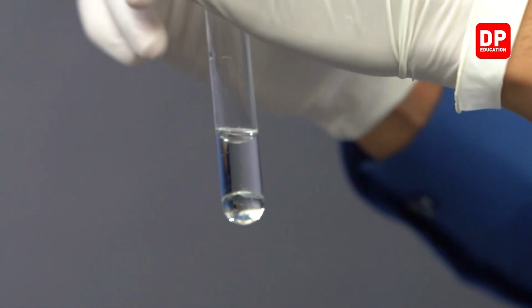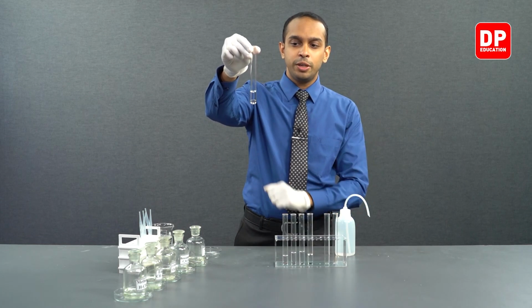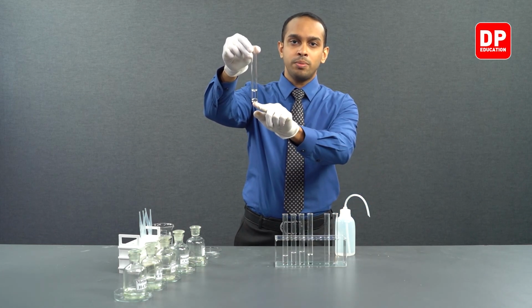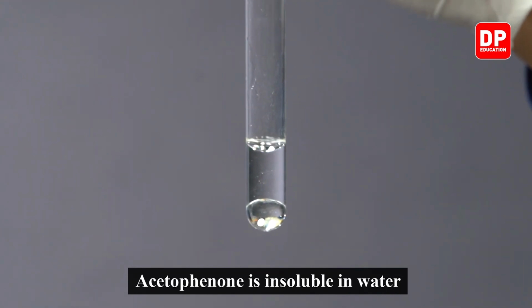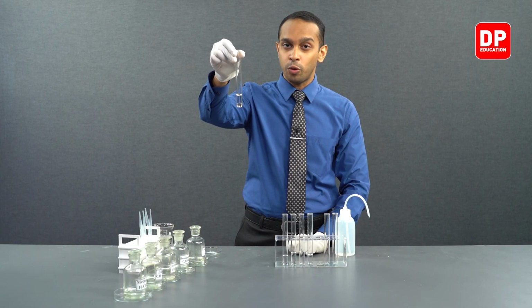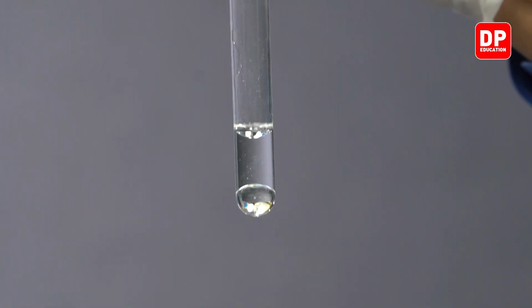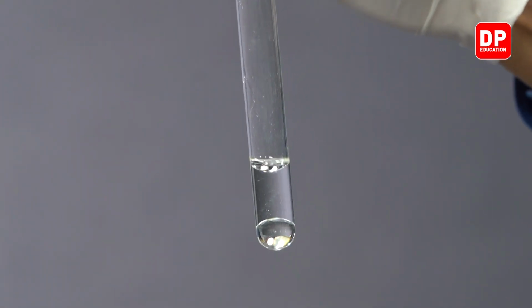You can see when we add water, acetophenone remains at the bottom as a separate layer and water is present on top as a separate layer. So water and acetophenone are now present as two separate layers, indicating that acetophenone does not dissolve in water.